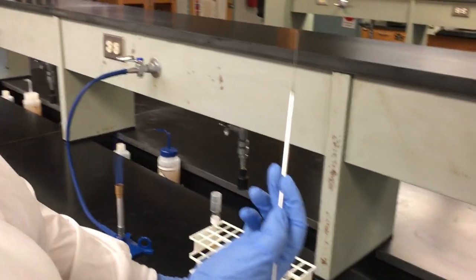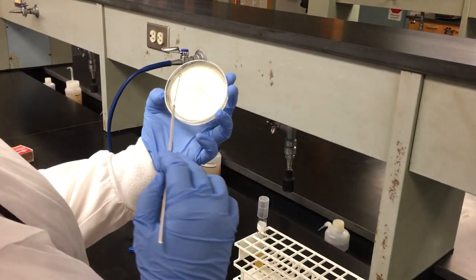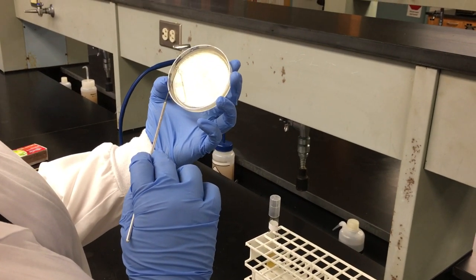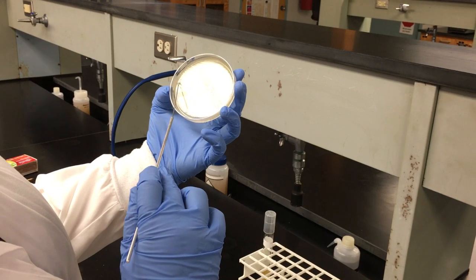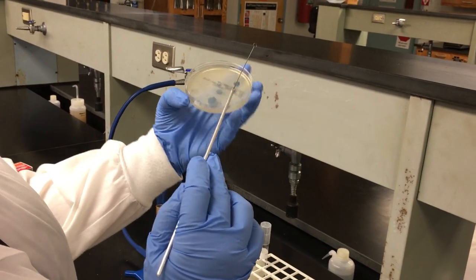To cool your loop, find a section of your plate that has not been streaked yet and gently turn your loop back and forth to cool your loop until you no longer hear a sizzle. Then turn your plate.